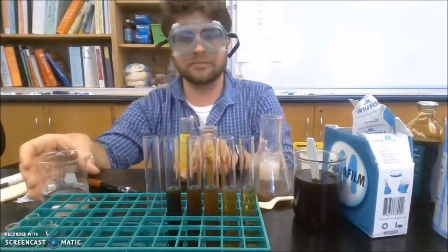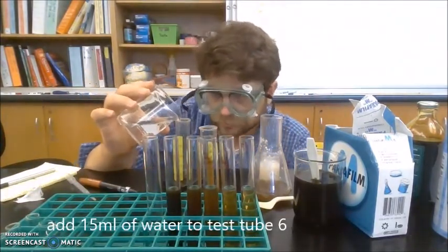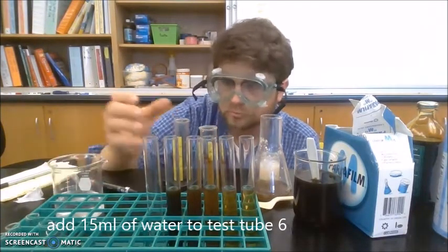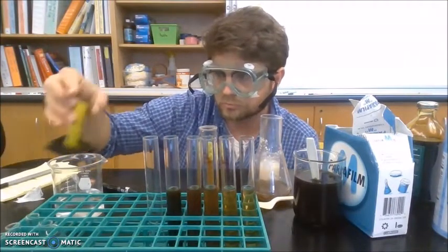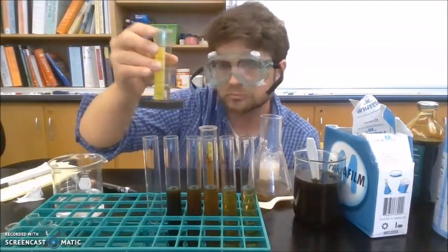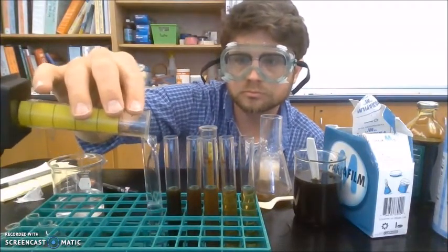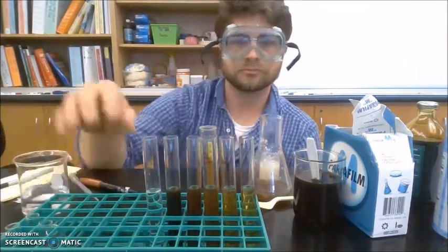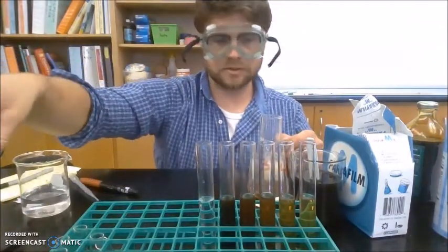I'm going to add 15 milliliters of water to a 6th test tube. There we go. Okay, so I can put this aside.